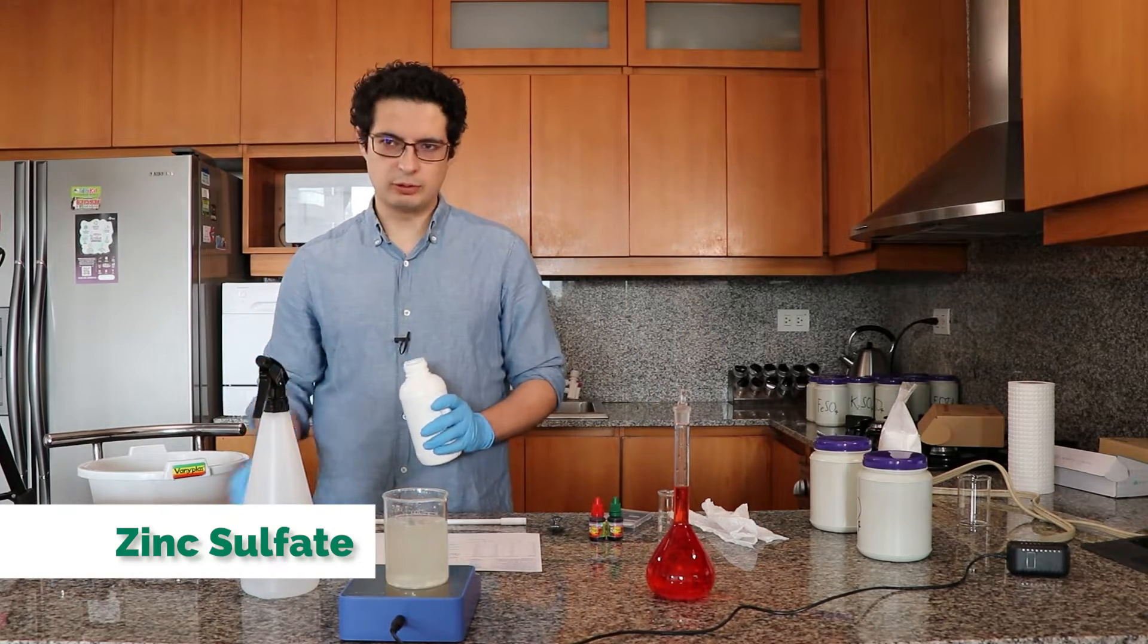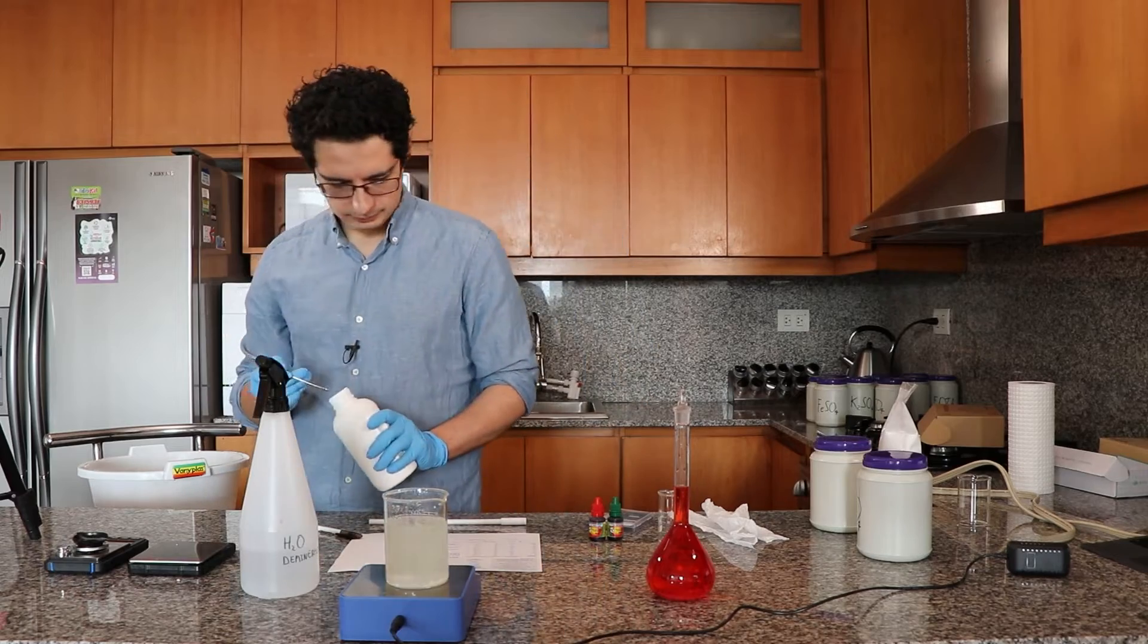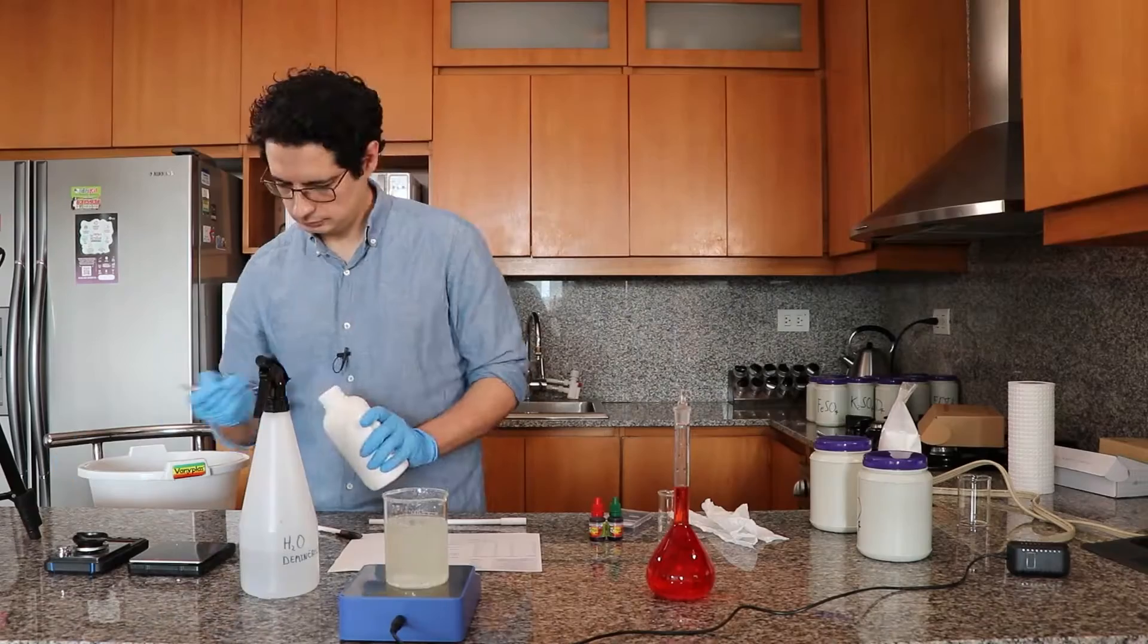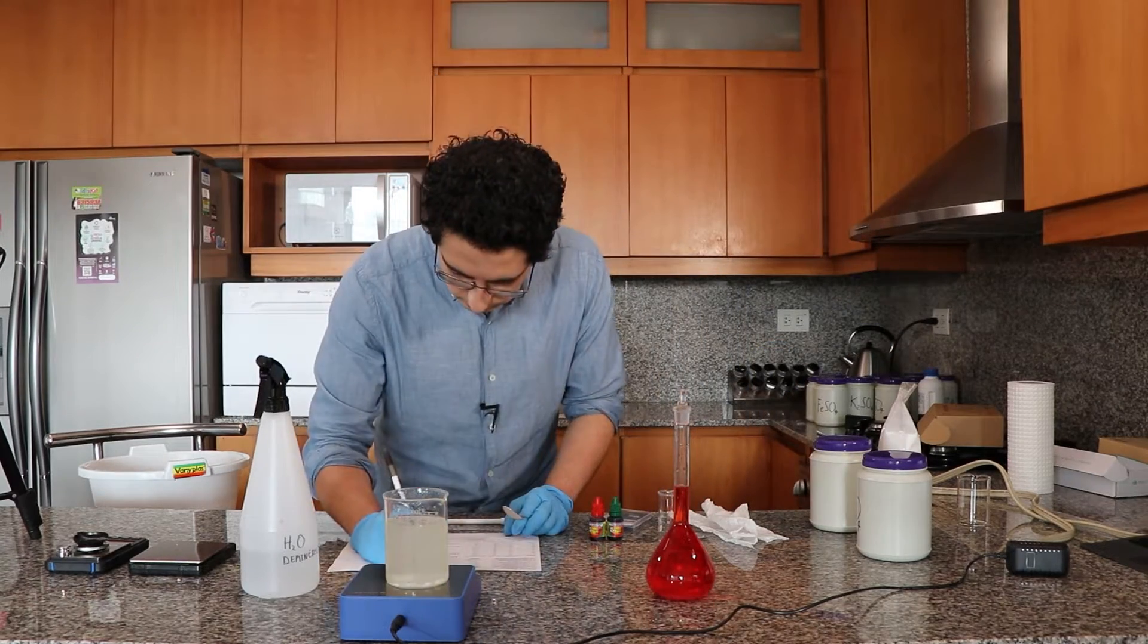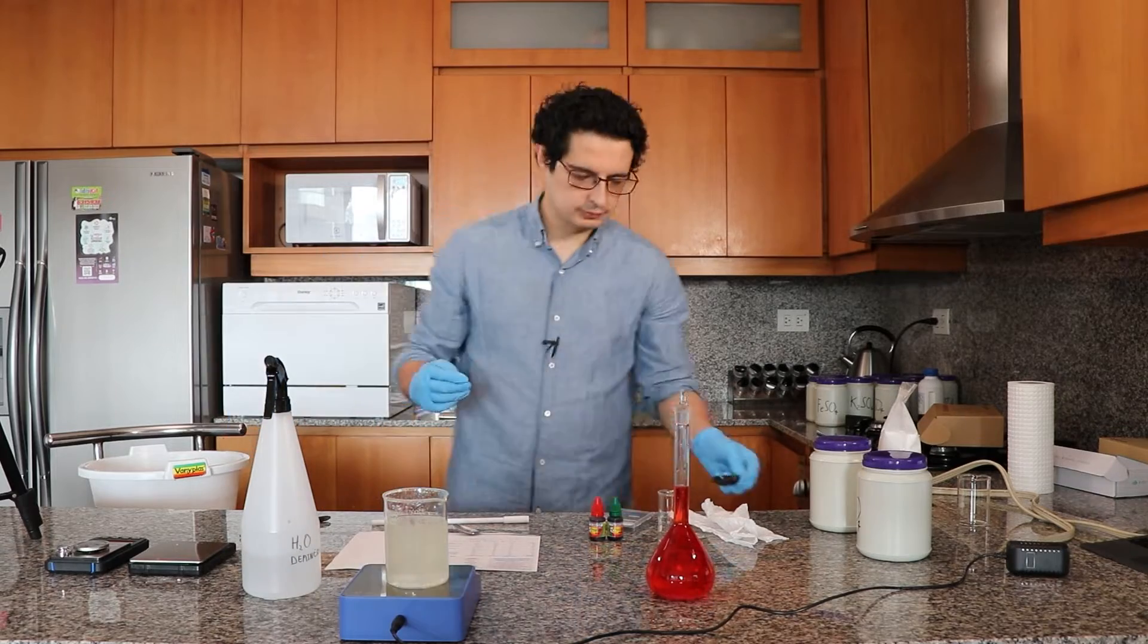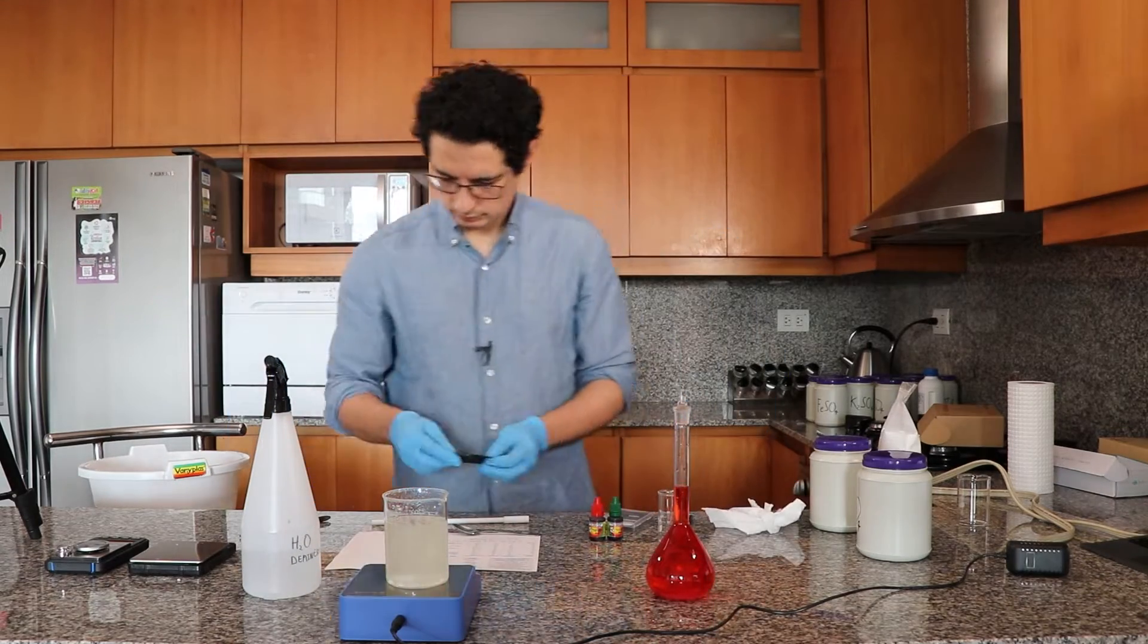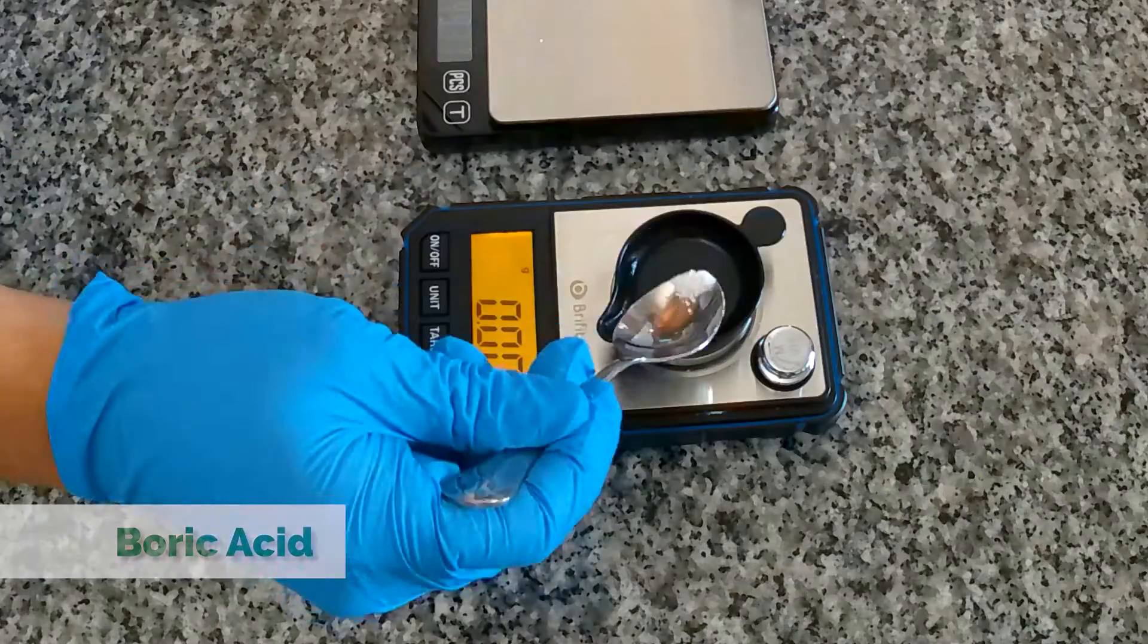Now I continue with the zinc sulfate in the exact same way. Notice that I'm writing all the salts that I'm adding and I'm writing the exact weights that I'm measuring so that I have those for reference later. Always do this.